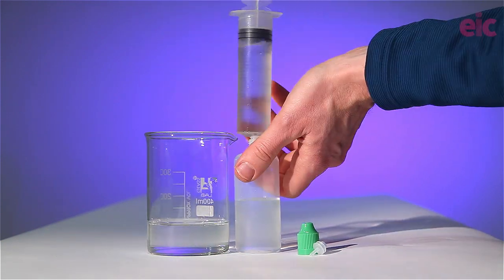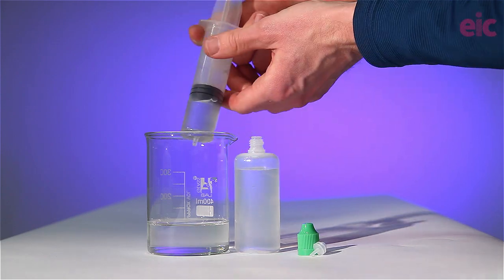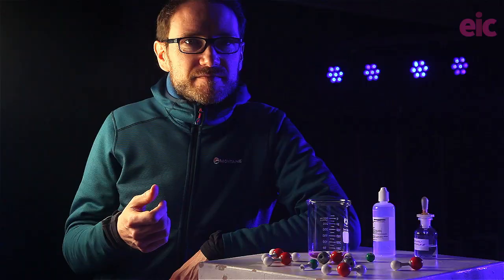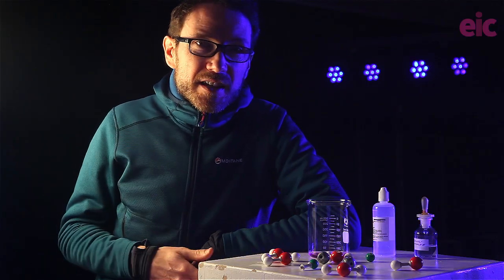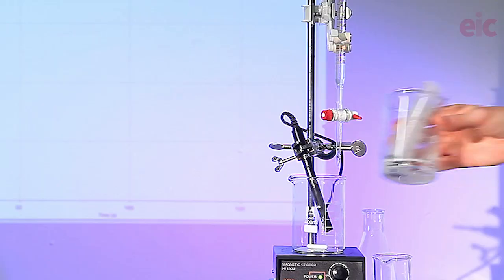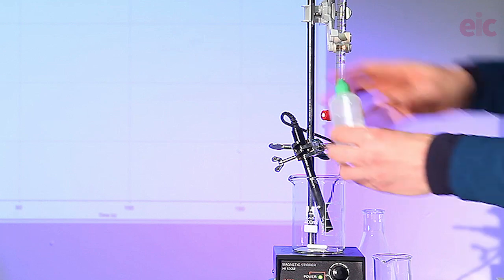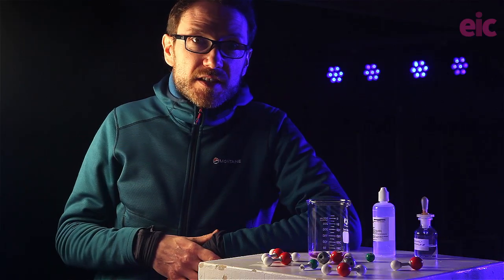I left some solution exposed to the air for about 20 minutes and showed what it looked like. Meanwhile, the dropper bottles without any guard tubes have lasted for well over a month so far with no signs of precipitation.